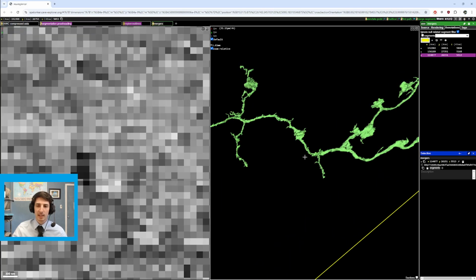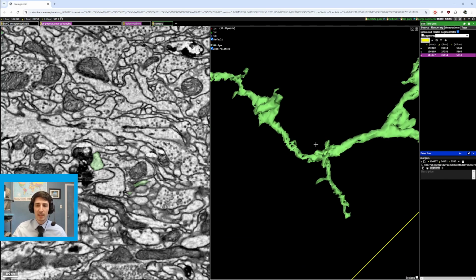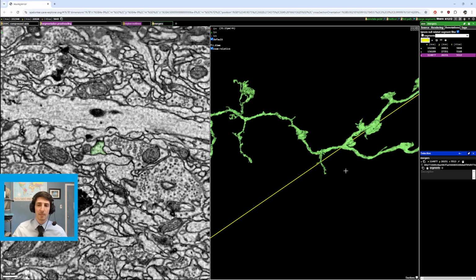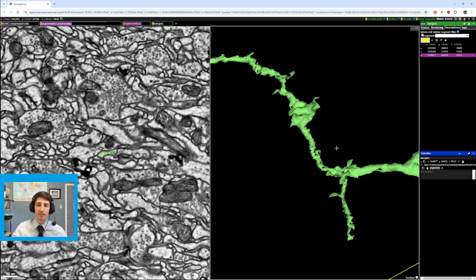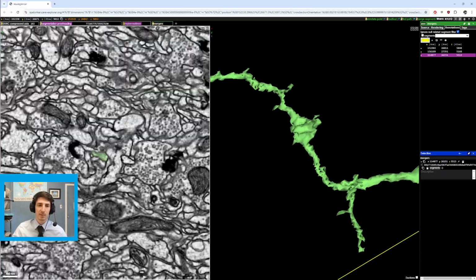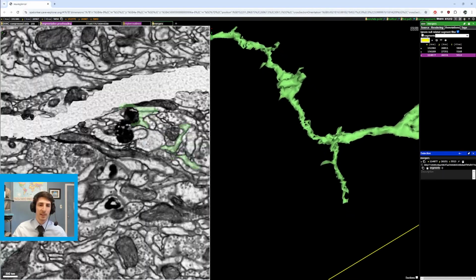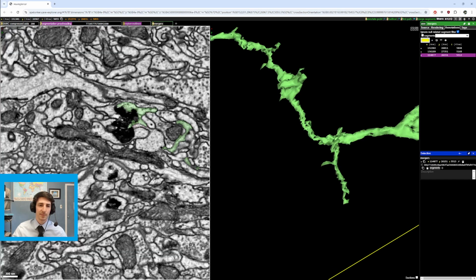and maybe you guys can tell from right here, but this branch and that branch are thicker than the branches they came from. And this was a big red flag, right? If the thickness changed from thin to thick, that is probably a sign that you've run into a merger. So I started at the thin area and I went up a little bit just to give myself some extra space to work with. I followed the path down, and then I got to this membrane swirl, and if we go slice by slice, you can follow it through.